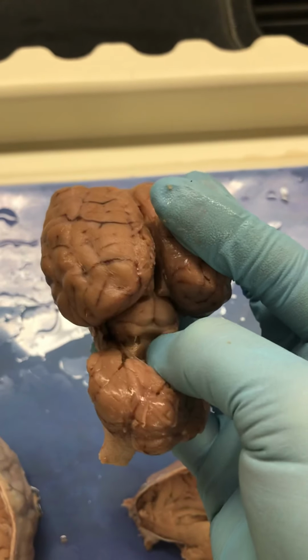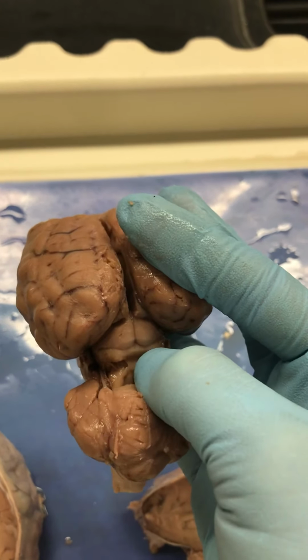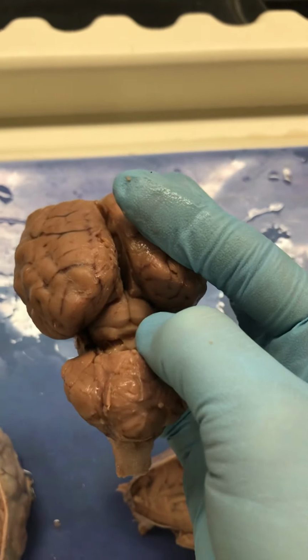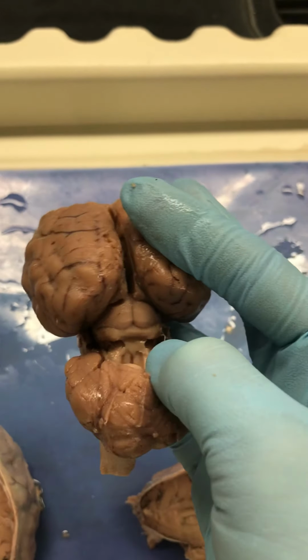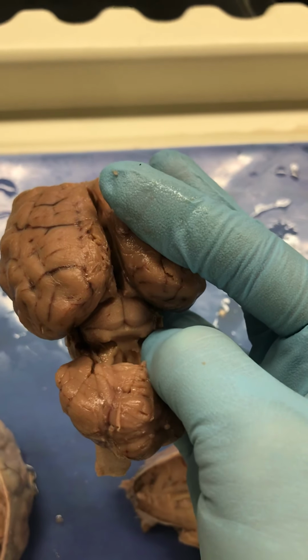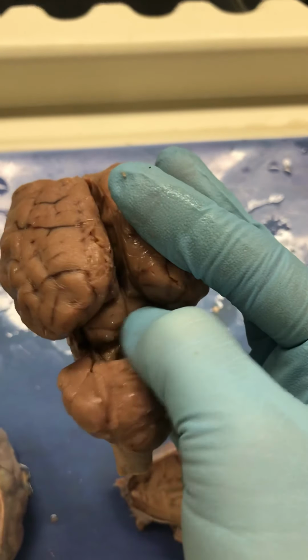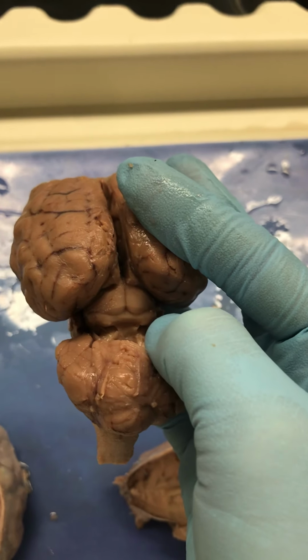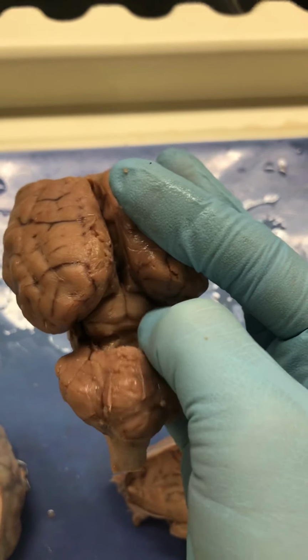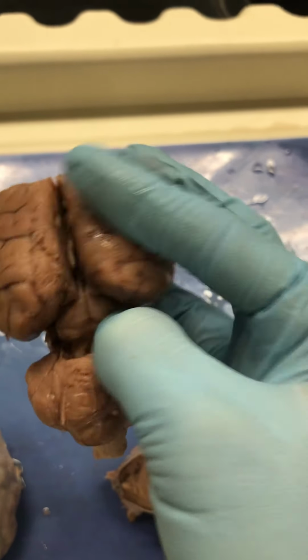That butt right there that I'm squishing on, that's the inferior colliculus of the Corpus Quadrigemina. Corpora means body, like a corporation is the major body of a company. And quadrigemina, there's 4 of them, 1, 2, 3, and 4. The top one is superior reflexes of vision. So superior colliculus is visual reflexes, and inferior colliculus is auditory reflexes.